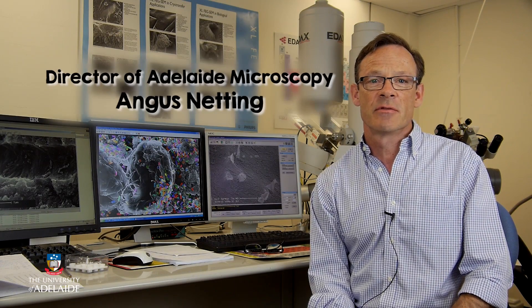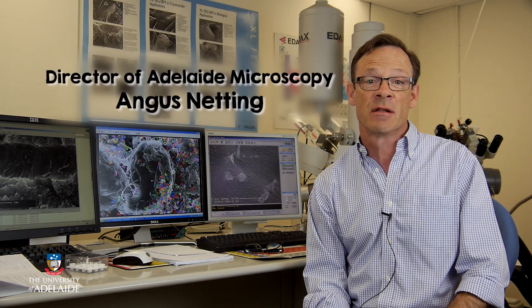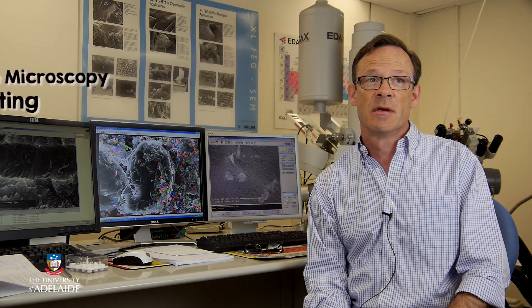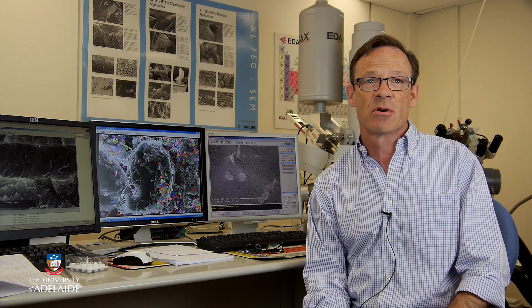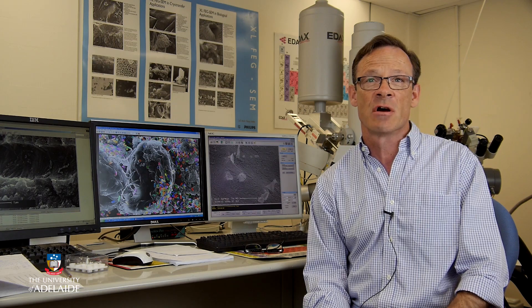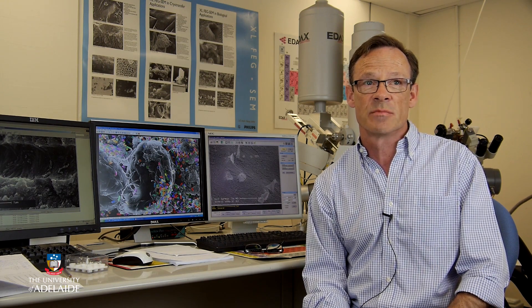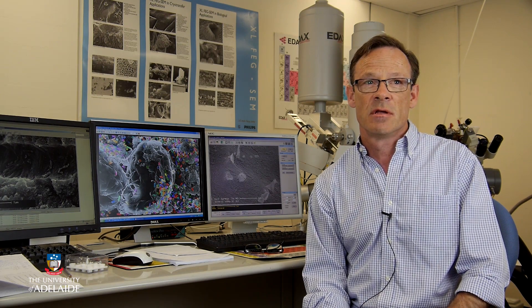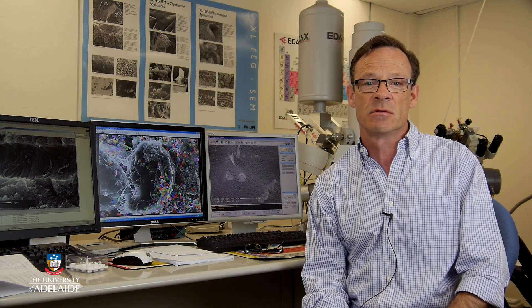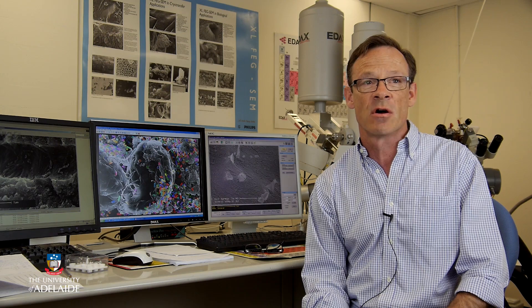Hi, I'm Angus Netting, the Director of Adelaide Microscopy at the University of Adelaide. At Adelaide Microscopy, we house the University's collection of light, electron and confocal microscopes. These microscopes magnify cells and allow us to see greater detail than is possible with the naked eye.